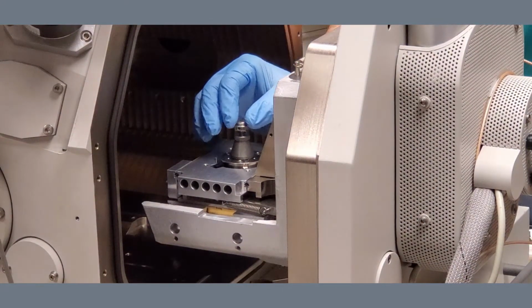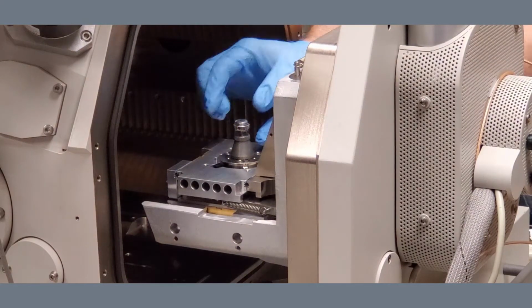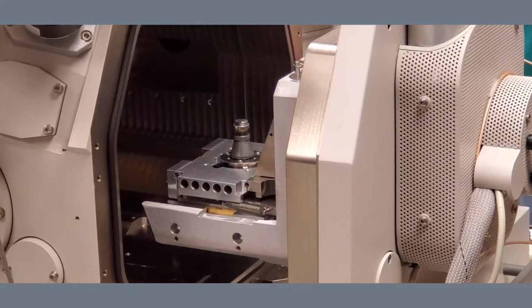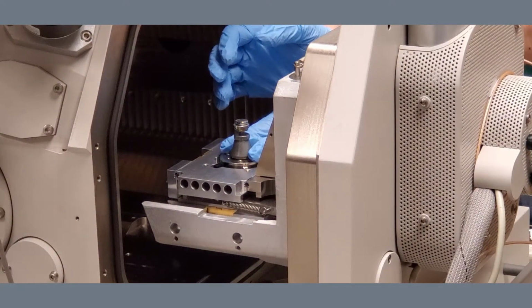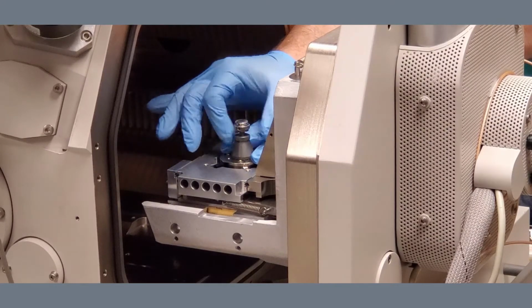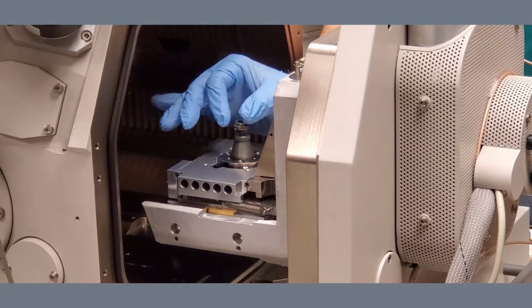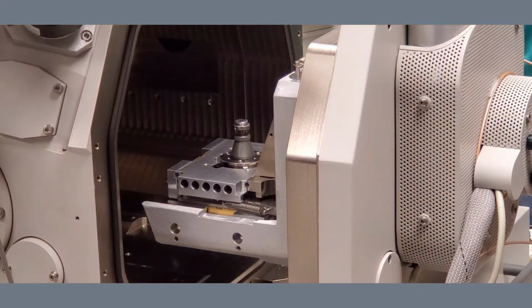If you find that the top is good but the entire assembly is loose, it's very simple to fix. Here you can kind of see it's wiggling right now. Hold the base and simply turn the cone section until it is tight. And then your sample is nice and solid. And especially if you're going to do high resolution work, having your sample be stable is incredibly important.